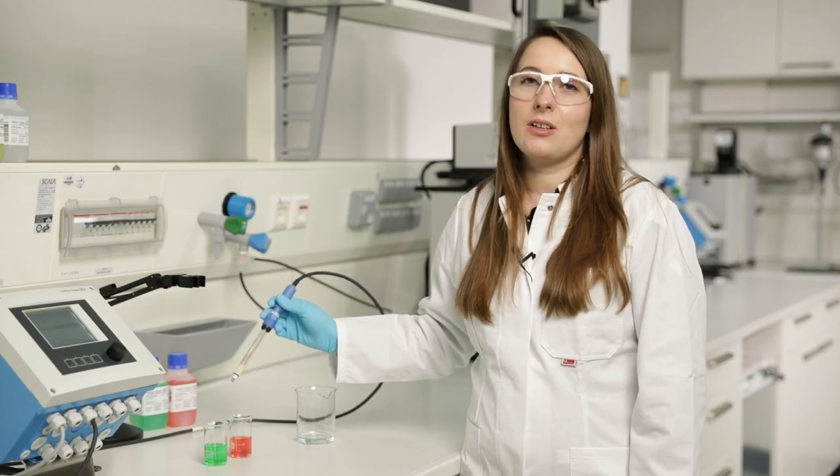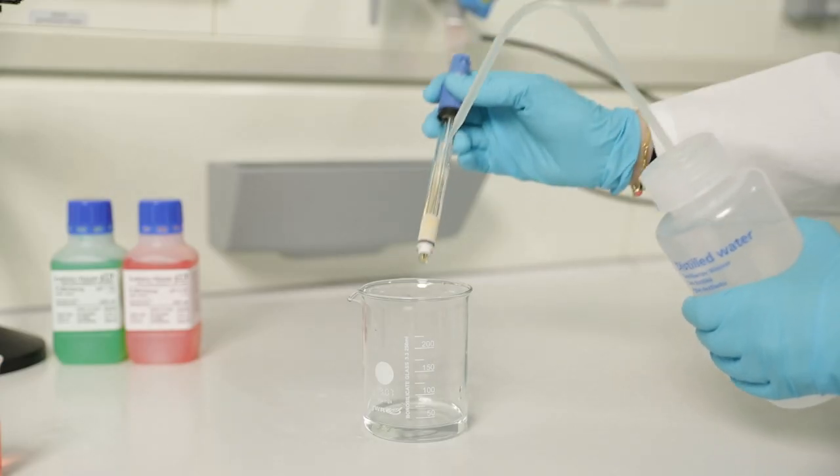The calibration data is now stored in the sensor. Now rinse the sensor with distilled water.